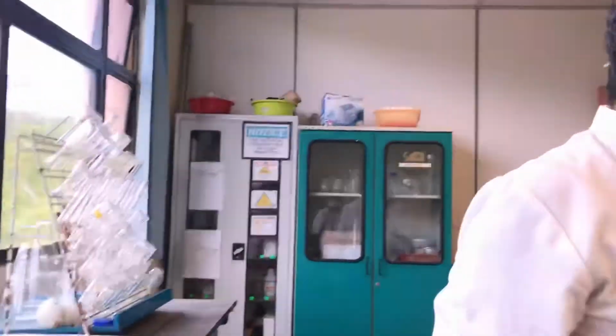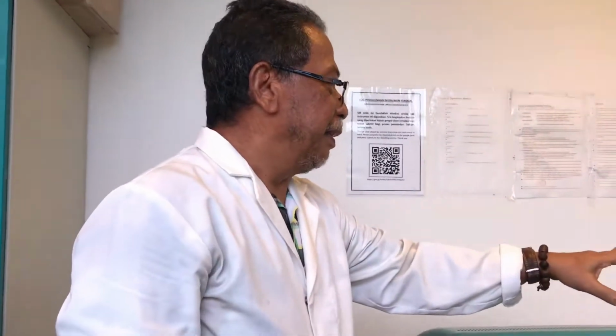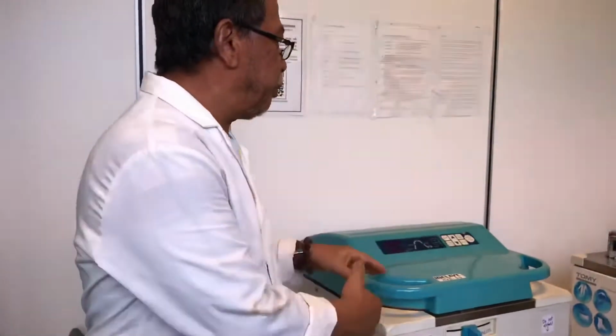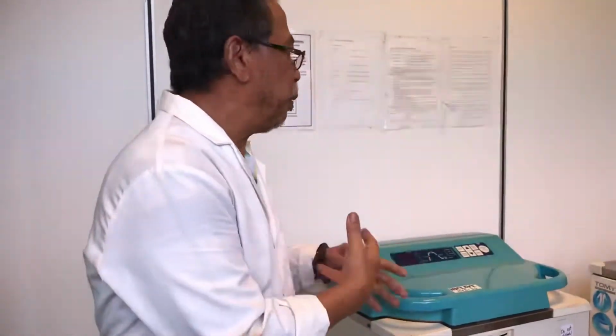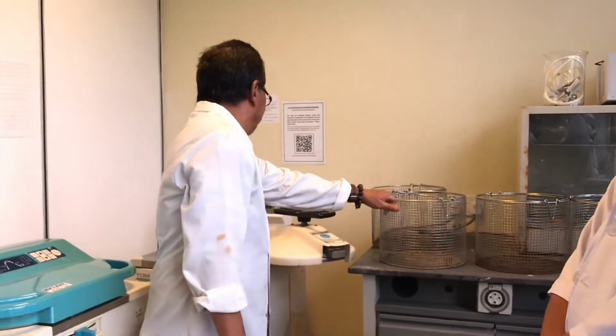Usually in a lab, we need at least two. For example, one is only for waste, the culture or the waste, and the other one just for glassware. That will be clean. You don't mix, unless you have no choice. When you do the waste, just waste, and when you do the clean glassware, just put it in this basket. They can do 2, 3.